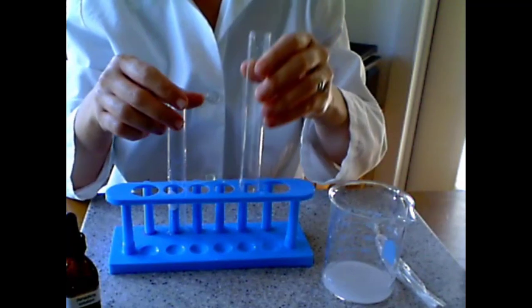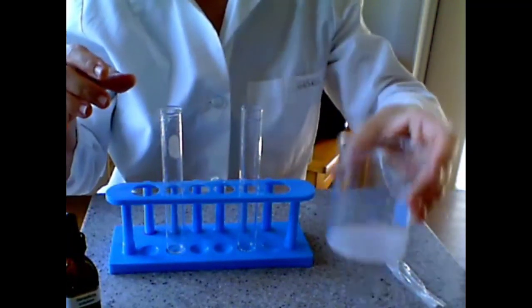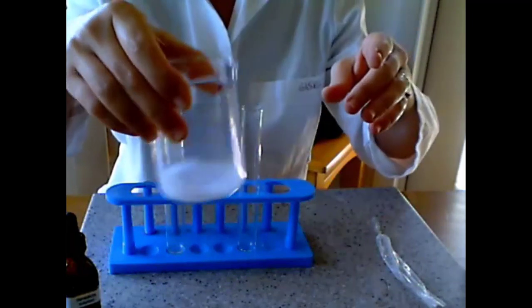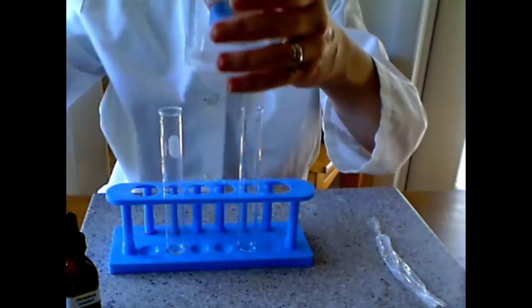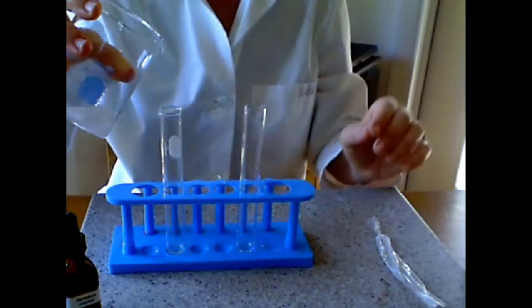Now we are going to get two clean test tubes, and we are going to do the same testing in the water that was inside of the dialysis tubing, which is here in the beaker. I'm going to divide it into the two test tubes.